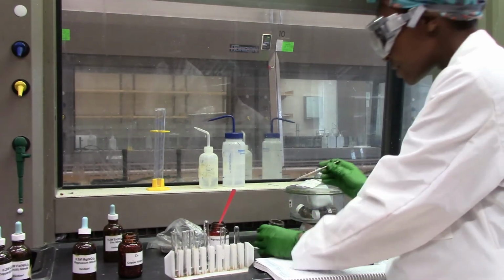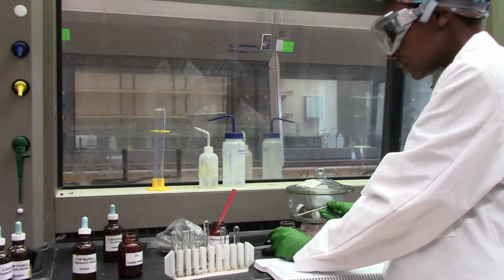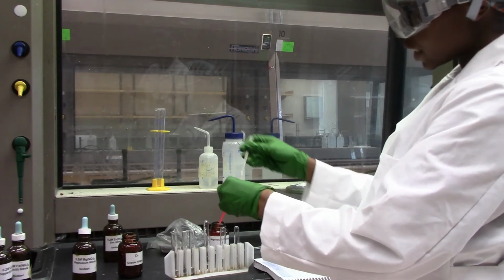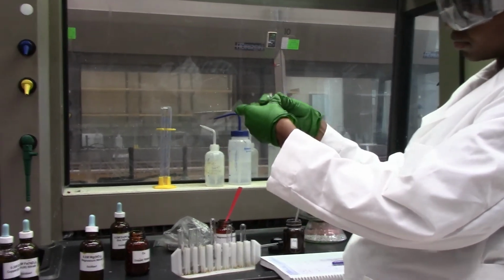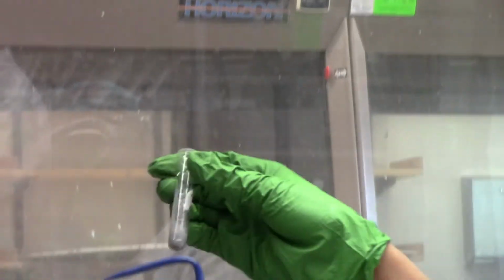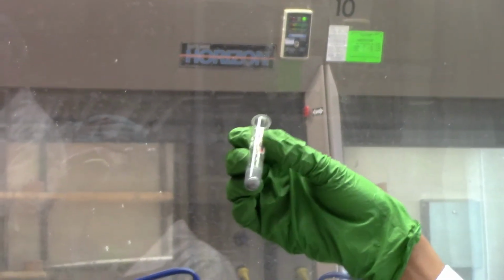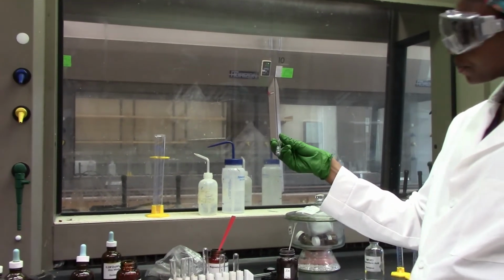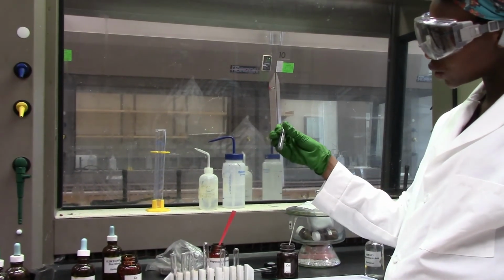And finally with zinc versus magnesium, I think this is what we wanted to find out. Alright, interestingly, the zinc is just sitting in solution as well. So it looks like we have a gray solid inside of the magnesium nitrate solution. So we can conclude that zinc does not displace magnesium, and that should tell you the reactivity between the two metals.